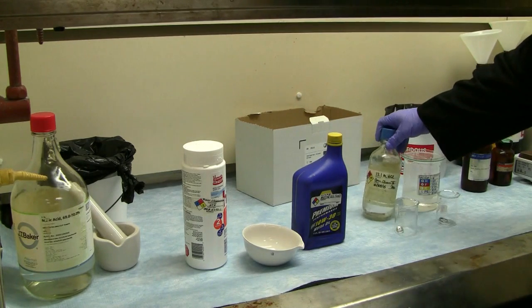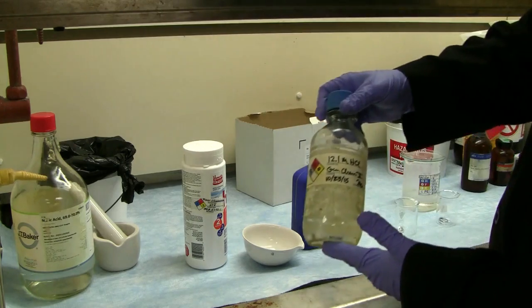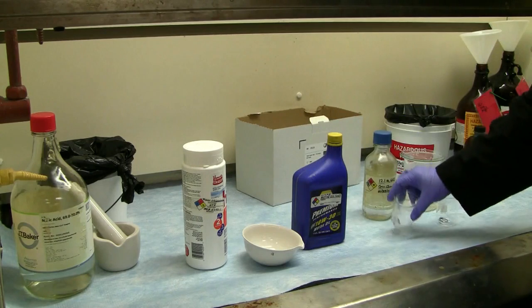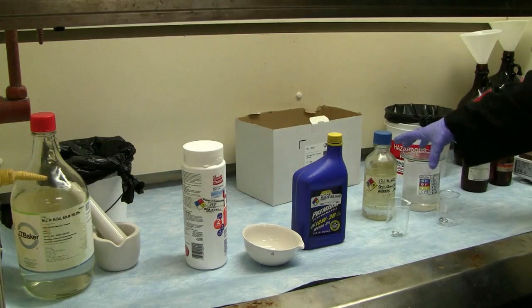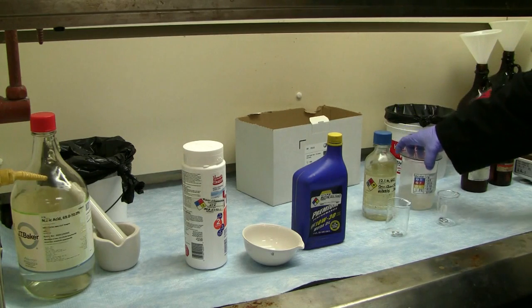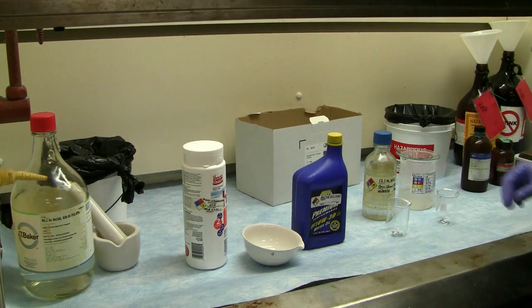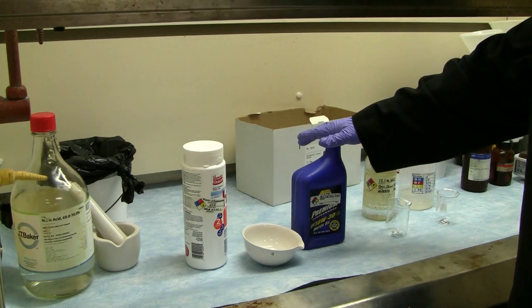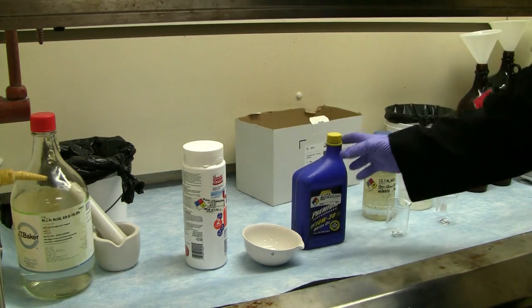In addition to that, we have a couple other reactions where we're going to be using hydrochloric acid, 12 molar, which is 37% concentration, with aluminum. And then we're also going to look at sodium hydroxide, 20 normal sodium hydroxide, with aluminum, and look at those particular incompatible reactions. Now this one right here might take a little bit, so when it starts going, we'll come back to it. But let's go ahead and do this right now.